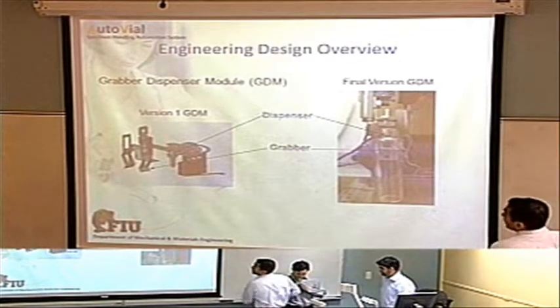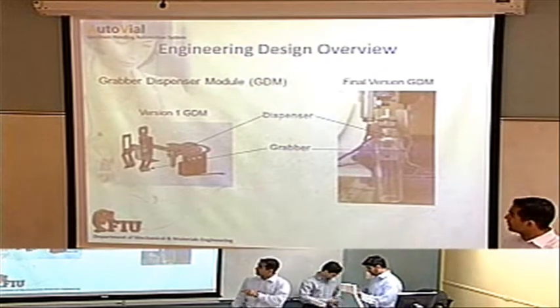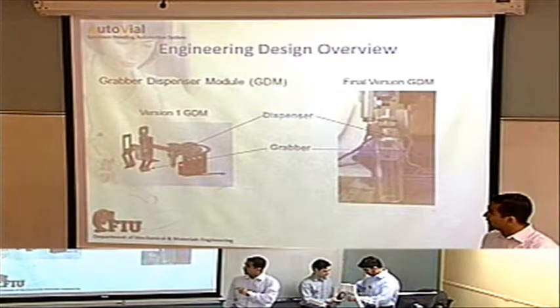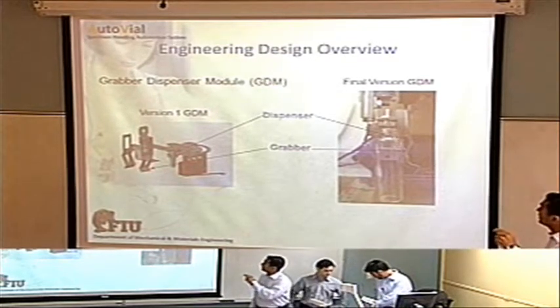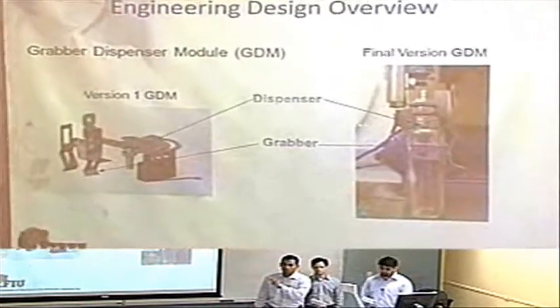This is the grabber dispenser module, or GDM. This was the first version that we came up with. The problem was that the actual dispenser was to the side, and it would interfere with our vials. So we decided to put it inside the grabber, so that we eliminate processing time of the machine.